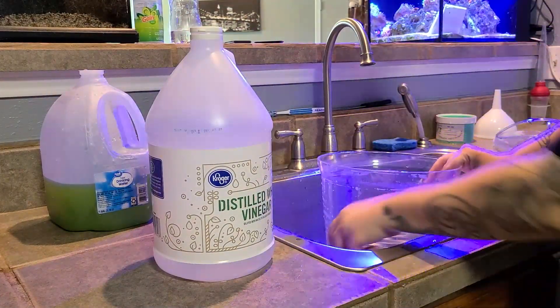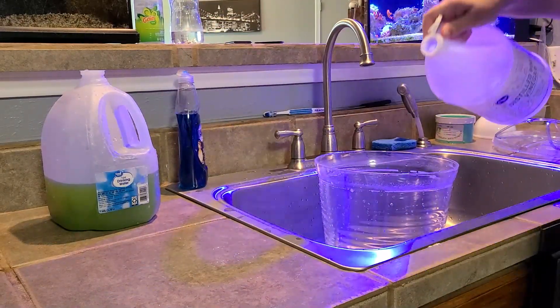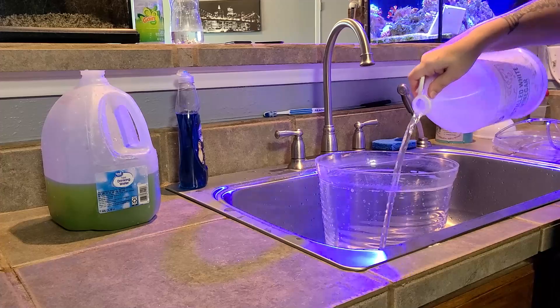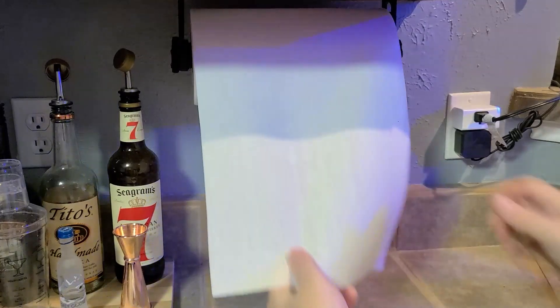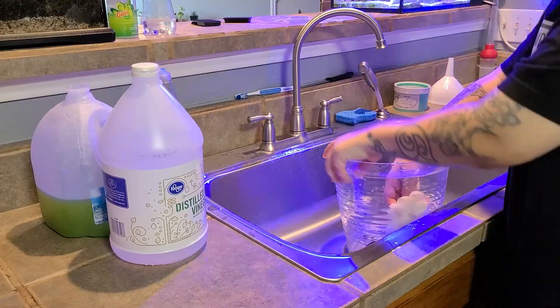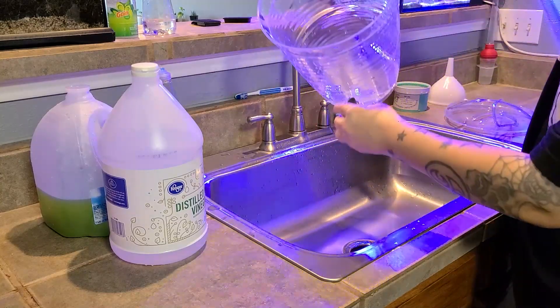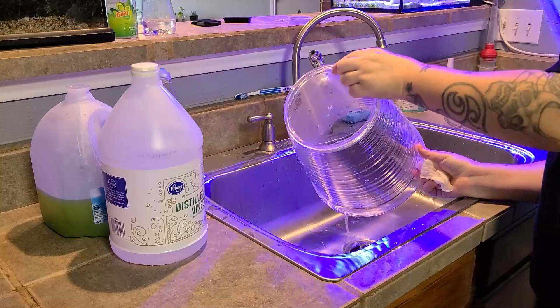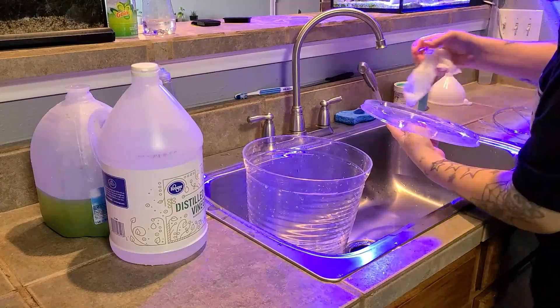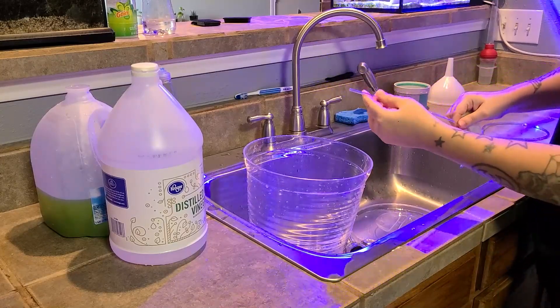I'll use plain distilled white vinegar. Pour a little bit into the culturing container and just wipe it down with a paper towel — that's plenty. Don't forget to run a little vinegar through your spigot, wipe down your lid, and also don't forget to wipe down your rigid airline tubing.